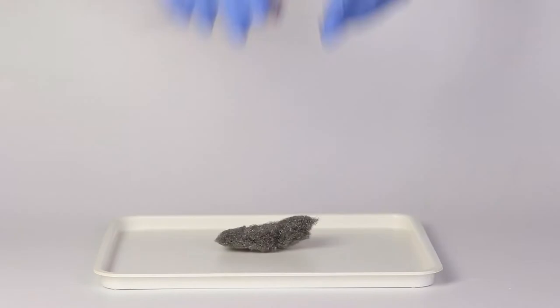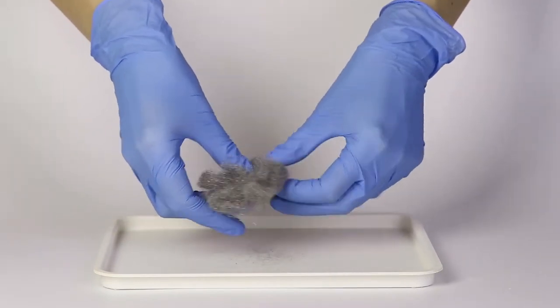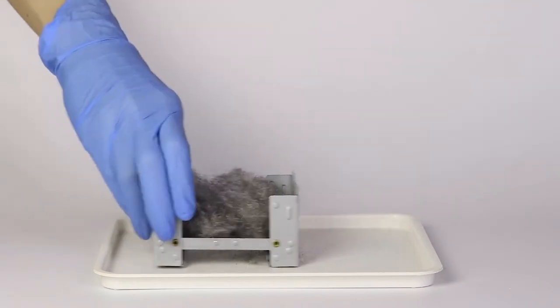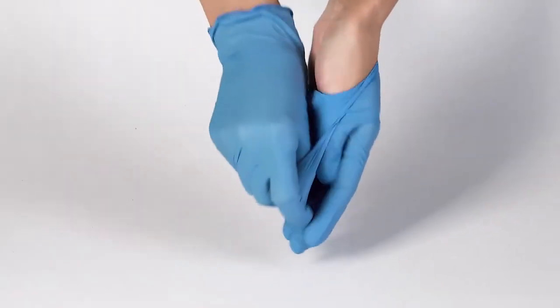Take a piece of iron wool and fluff it up as shown in the video. Then place the wool in the stove. Take the protective gloves off.